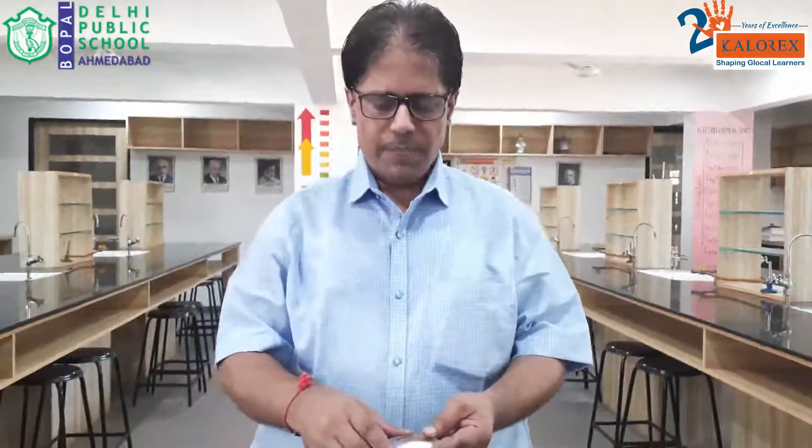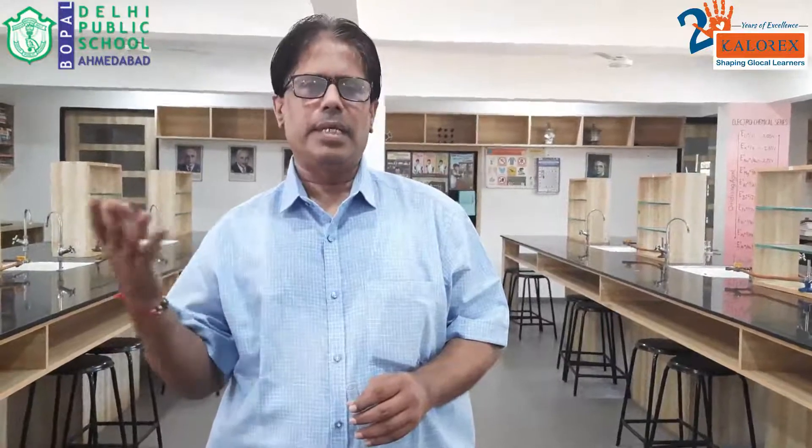Salt analysis: a white crystalline salt has been given. In a single salt, there is one cation and one anion, so let us carry out the analysis and find out what the cation and anion are. We start with the preliminary test, then we carry out the group test for cation, then the confirmatory test for cation, then anion analysis and confirmatory test for anion.